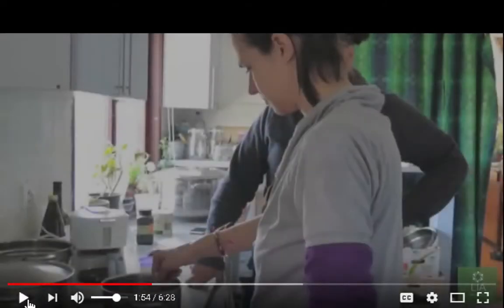Okay, so here I guess they're stirring in the mix while it's heating, which is different from another video. There are different ways of doing this, and maybe it all ends up being the same once you get it into a pressure cooker.